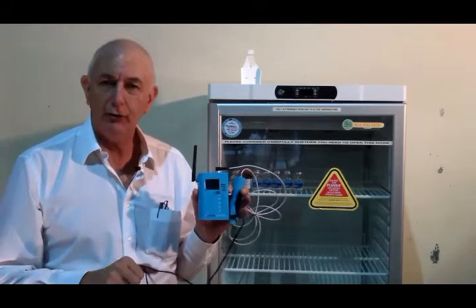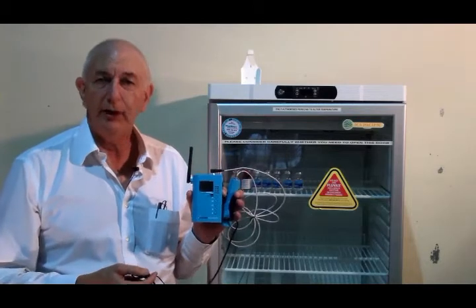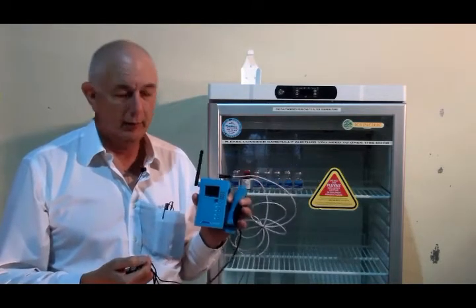When the data loggers are delivered to each outlet, they'll be pre-set up with all the details already done. So you don't have to worry about that. What you need to do is get it into the vaccine fridge.